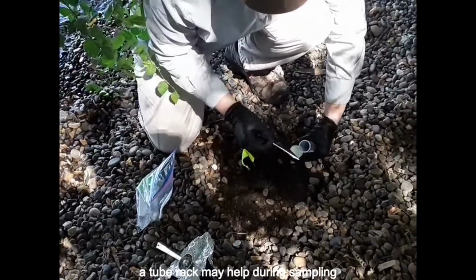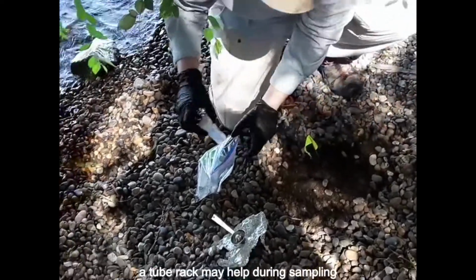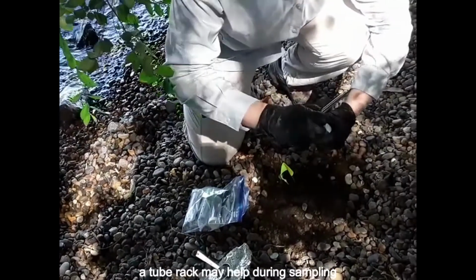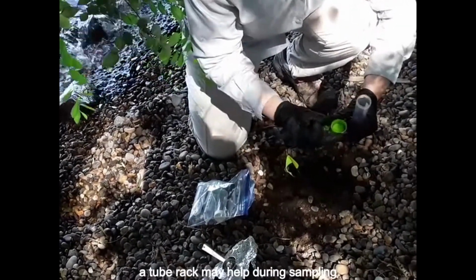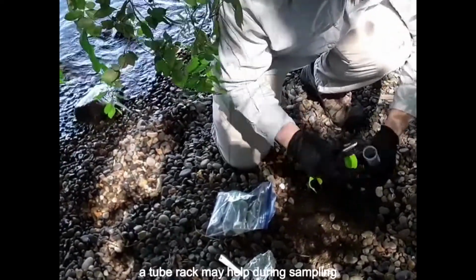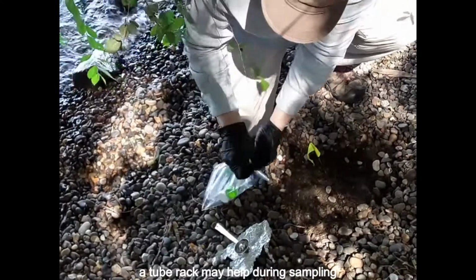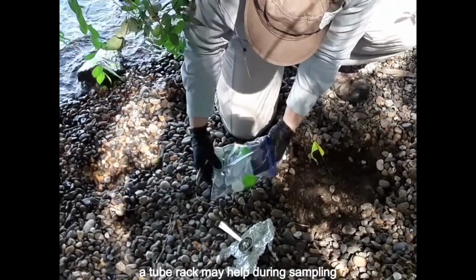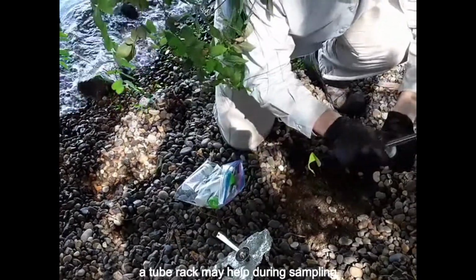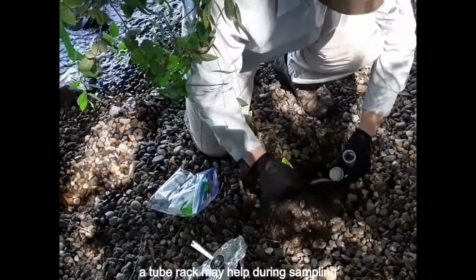Collect from at least 3 to 5 spots within the sampling location to get a representative sample. Keep the spots close together within 30 centimeters of each other and at a consistent elevation so that they would have experienced the same inundation dynamic. First, fill 1 50 ml empty tube and then the 25 ml empty tube. They are the highest priority. If you have sediment available at a given location, continue filling the other 50 ml tube. If there is enough sediment for both the RNA later tubes, collect those samples as well.